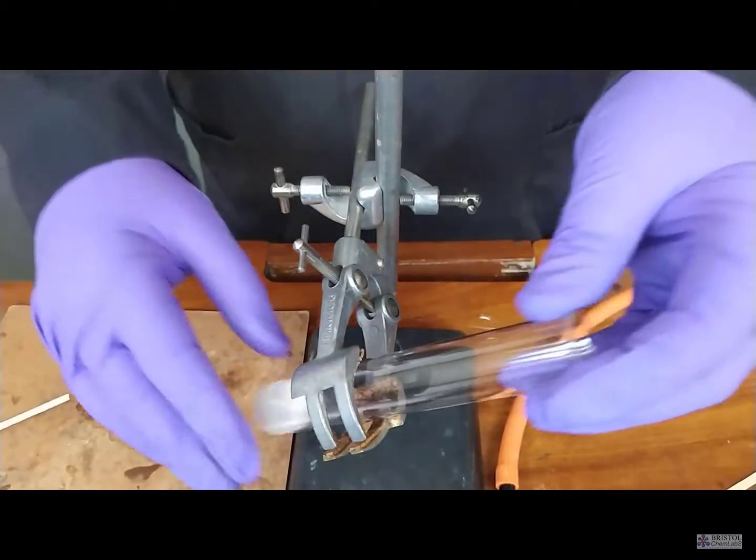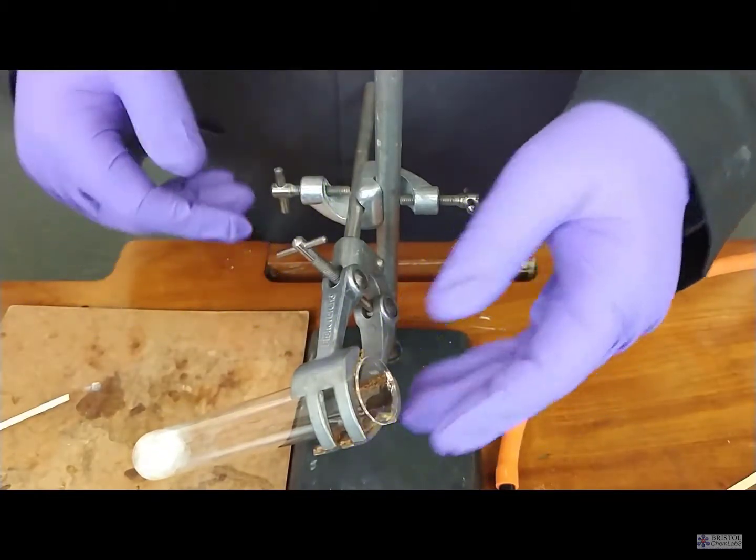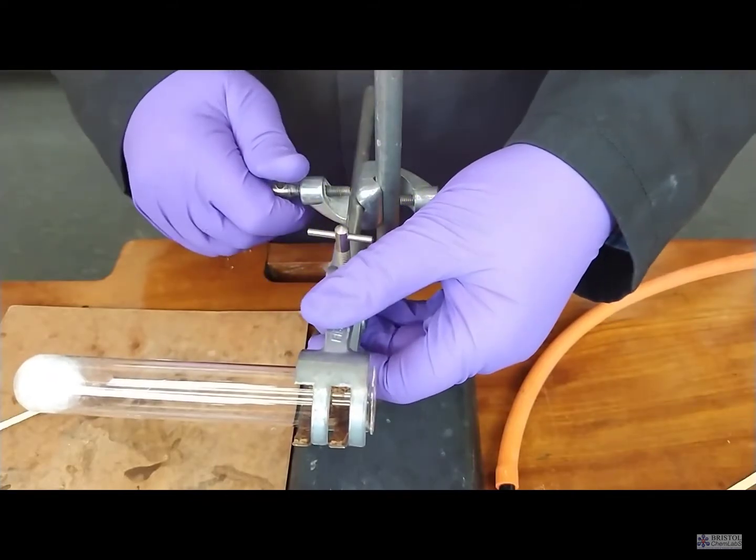You can use broken porcelain pots, the sort that you might use for evaporation in salt preps, instead. That's a bit easier for the students to manipulate.